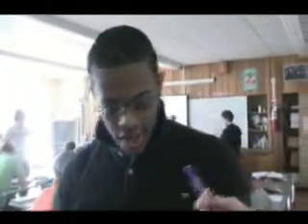If you could offer this experiment to somebody else, what would you tell them about it? So, like, what were the highlights of it? Be careful and don't get burned in the face. And make sure your flame stays blue, not yellow. Yes, you need to listen to the teacher and follow directions and not get put beside tall people that are in the way. Have to keep continuing to use your things. All right. Good night. Bye.